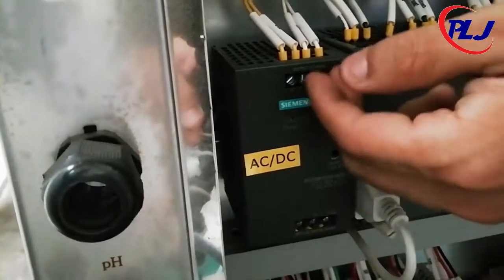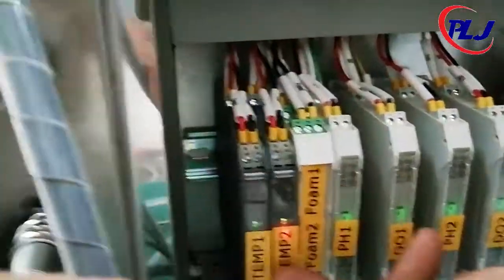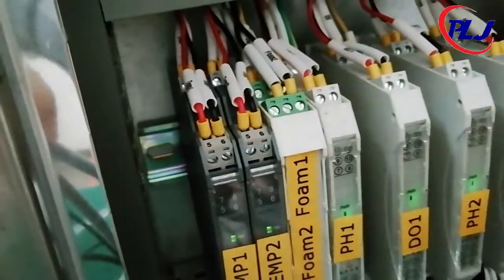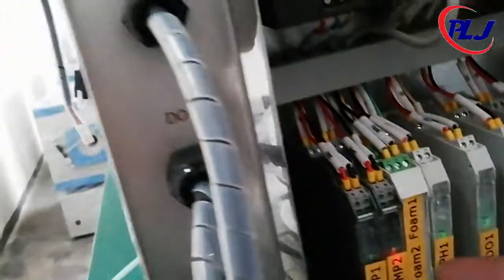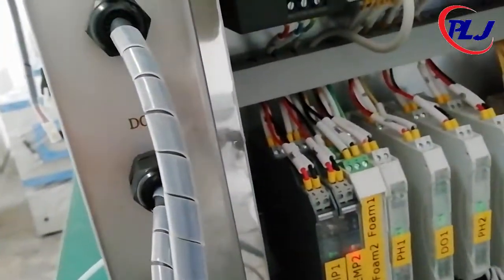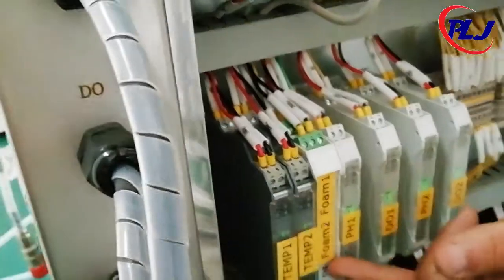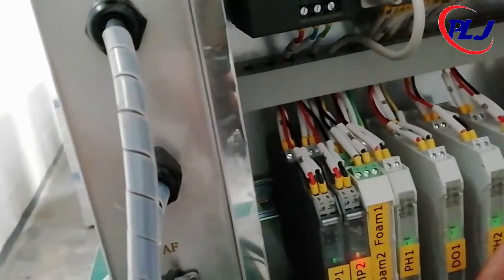The PLC is programmed to continuously scan all the input present values of the system and correspondingly update the outputs. For example, if the system is increasing the pH, the relay for the peristaltic pump will be open and the PLC will communicate with the control unit until the pH value is reached.